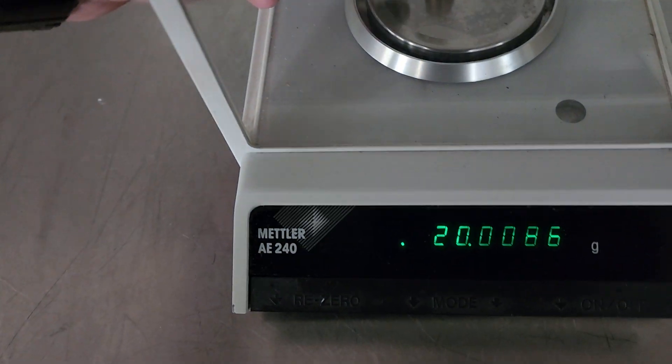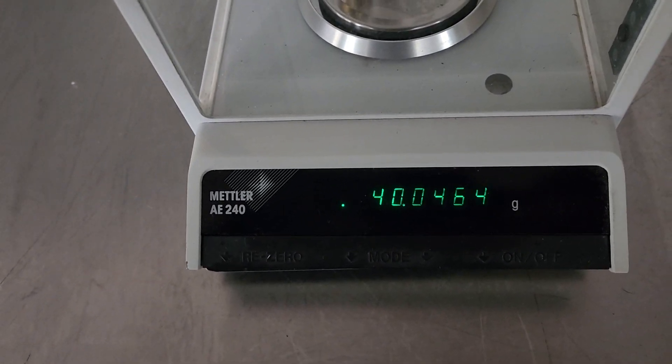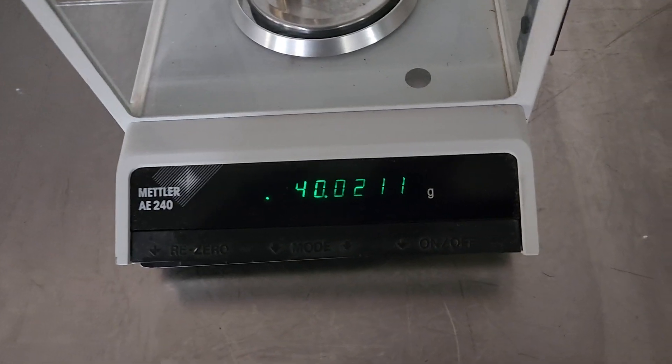It's got two 20s — well, let's put two 20s out there. We should have 40. And you can see it seems to work as it is.